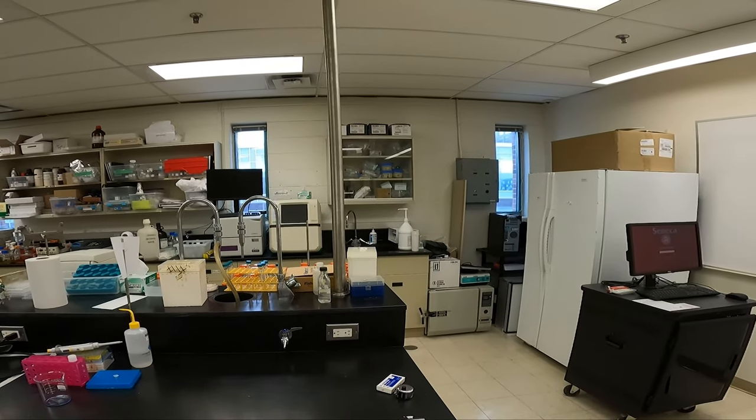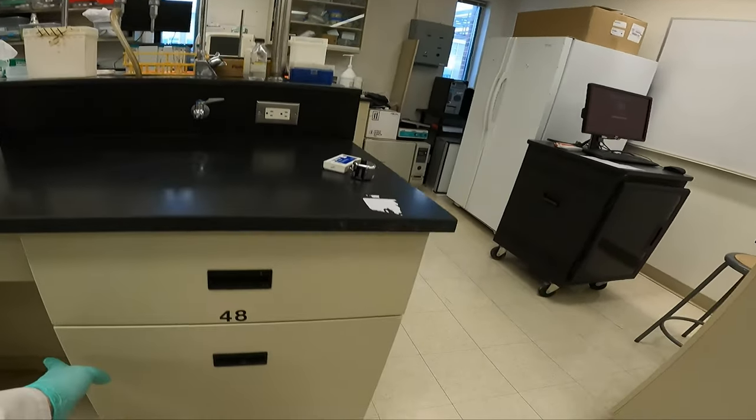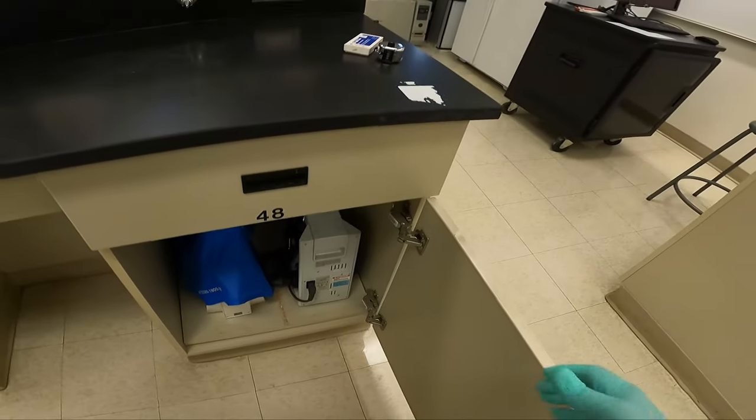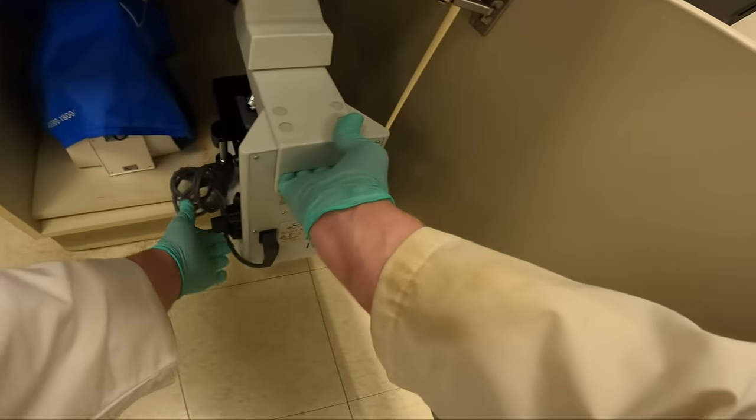Welcome to my lab. I'm Drew Collip. In today's lab, we're going to count cells using a hemocytometer and a compound microscope.